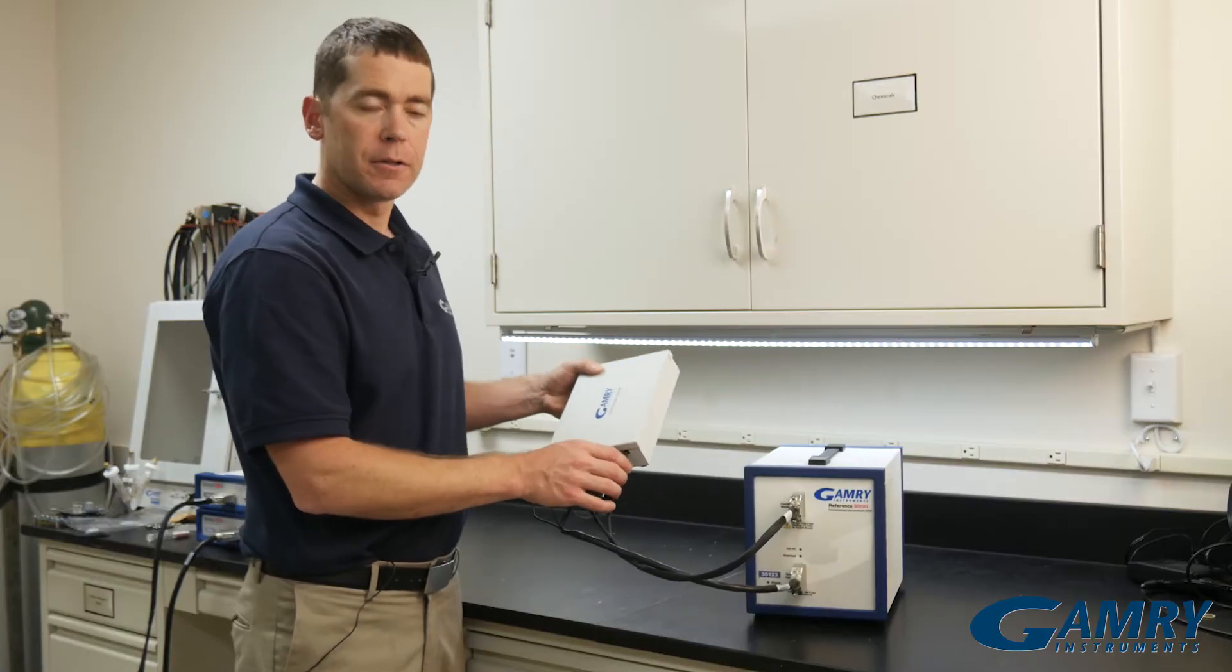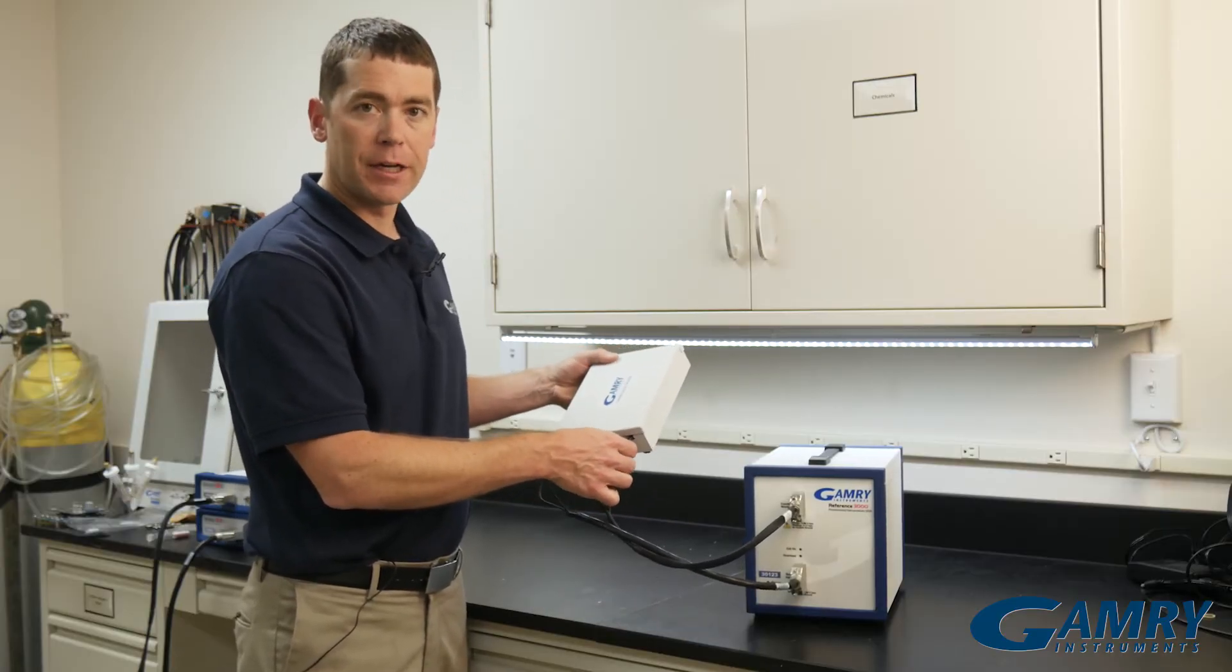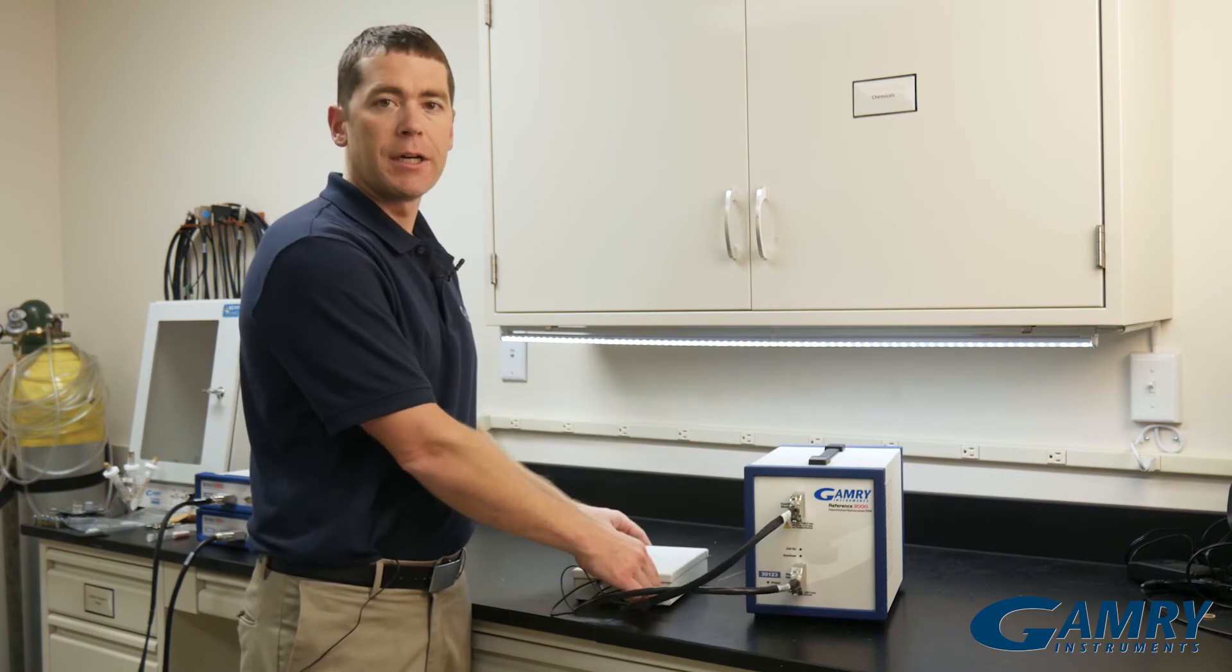So once you add your lid, you make a connection with your floating ground to the grounding lug, and then you're all ready to calibrate.